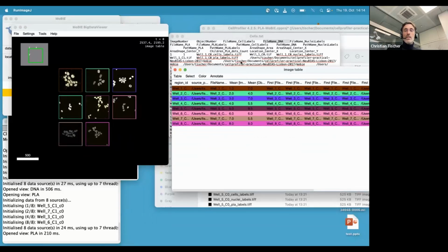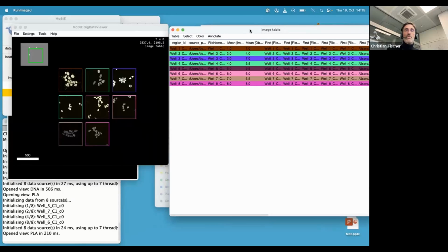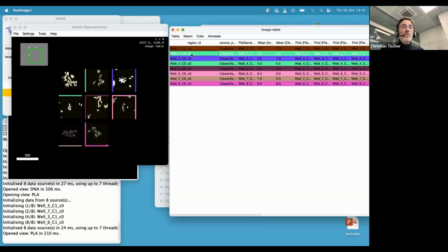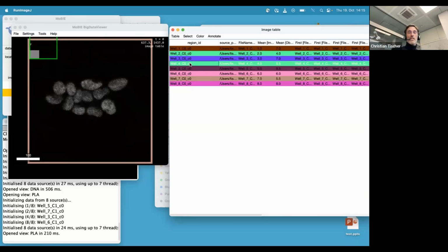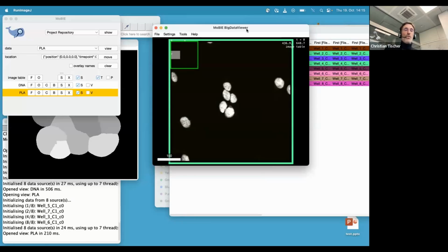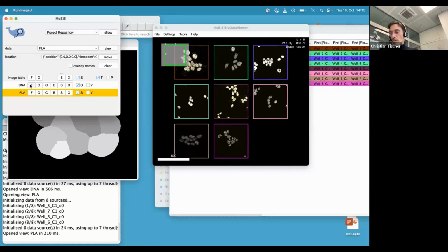Okay, then the other thing you can do is, here it actually created an image table for you, which you can use for browsing. So for example, if you want to see the data in well2, you can click there and then it would move to where you click at. Okay, so this can be convenient if you want to check something specific. Then if you want to get back to the full overview, there is a convenience. There is this F button that will always focus on whatever is represented in that layer. So for example, if I press F here, you get a nice overview of the whole thing.